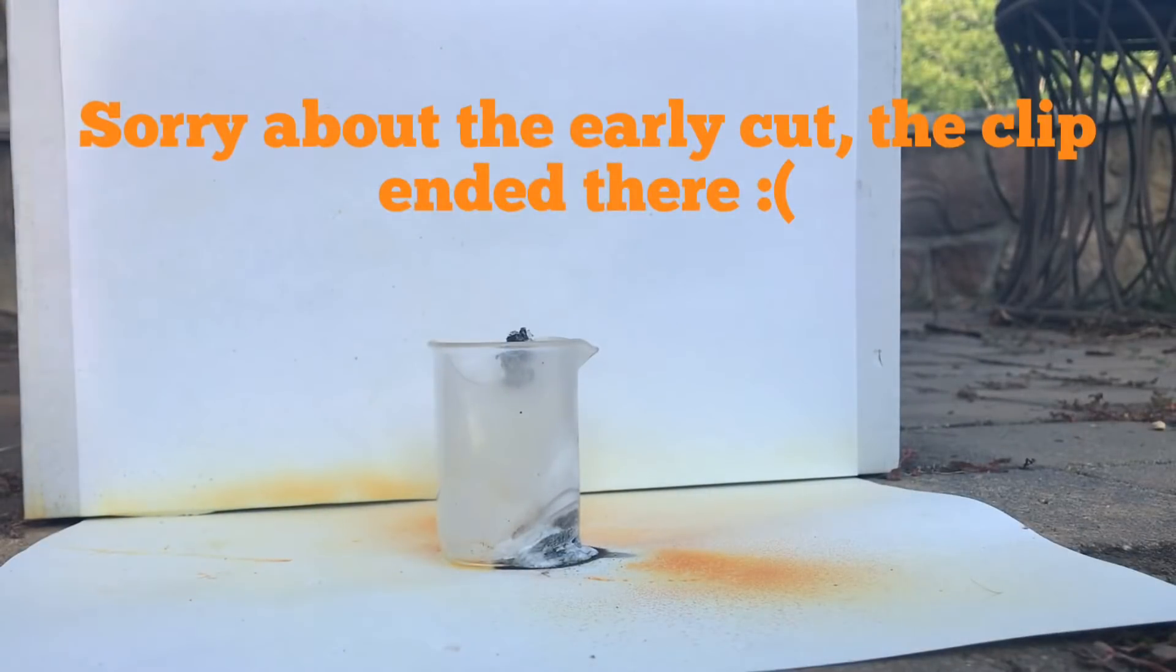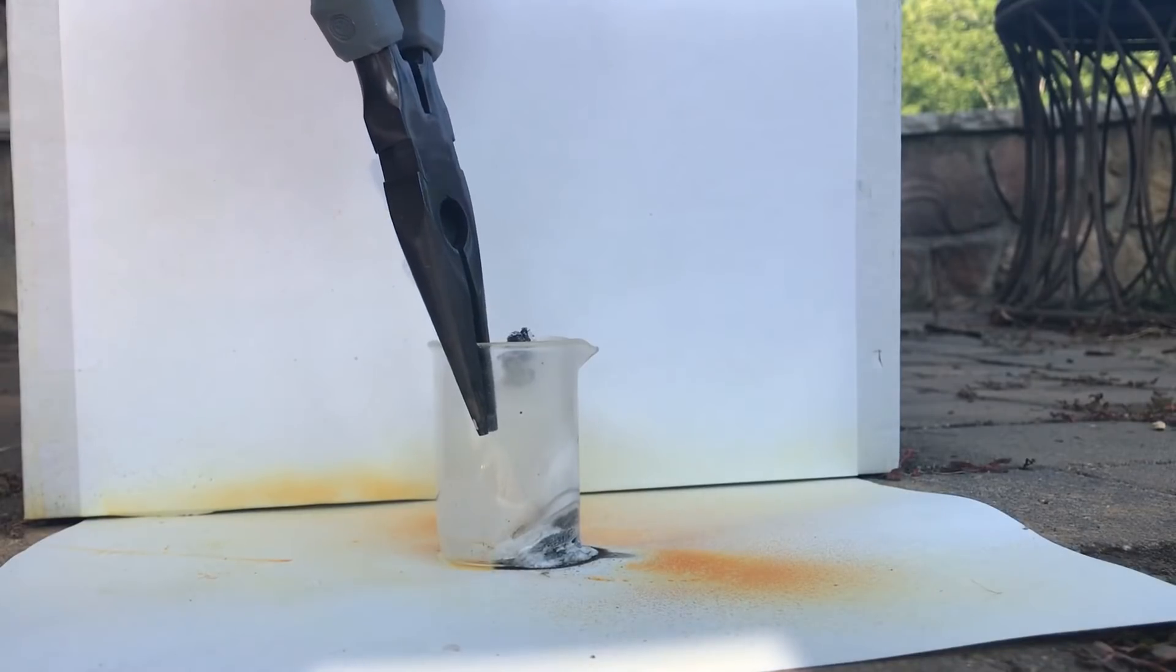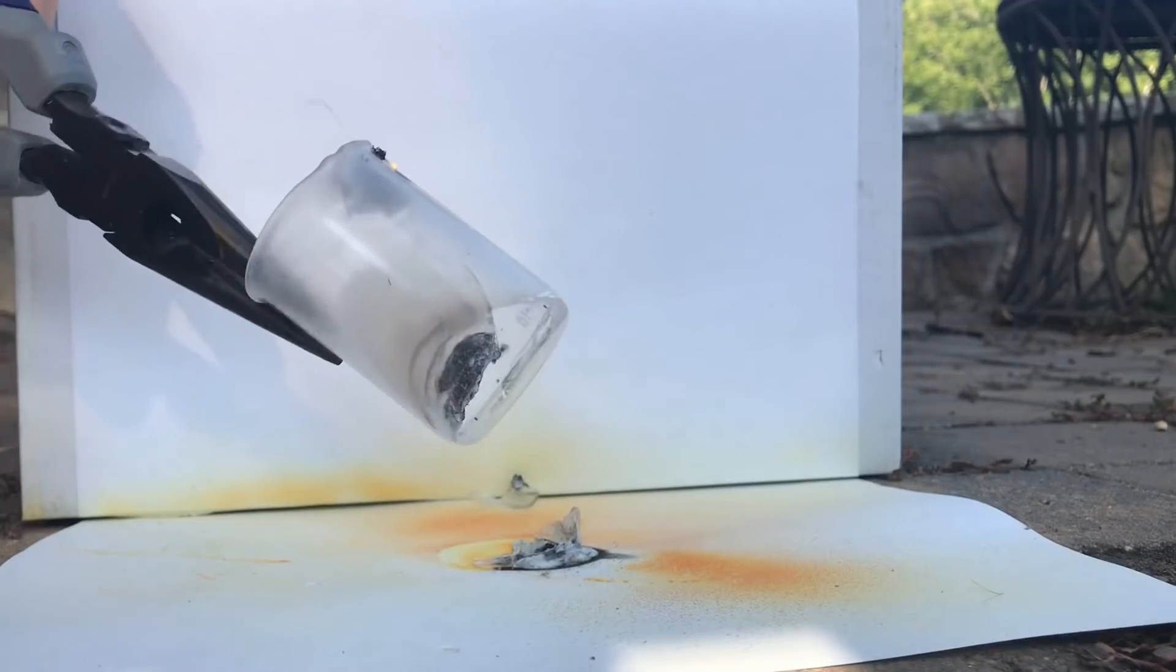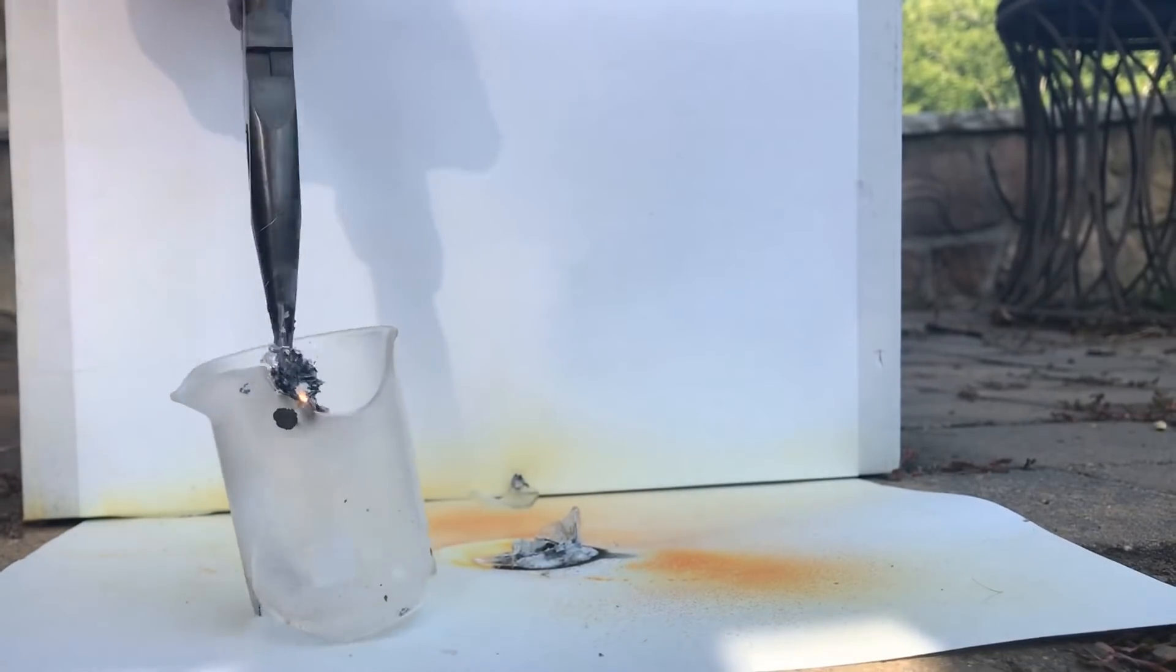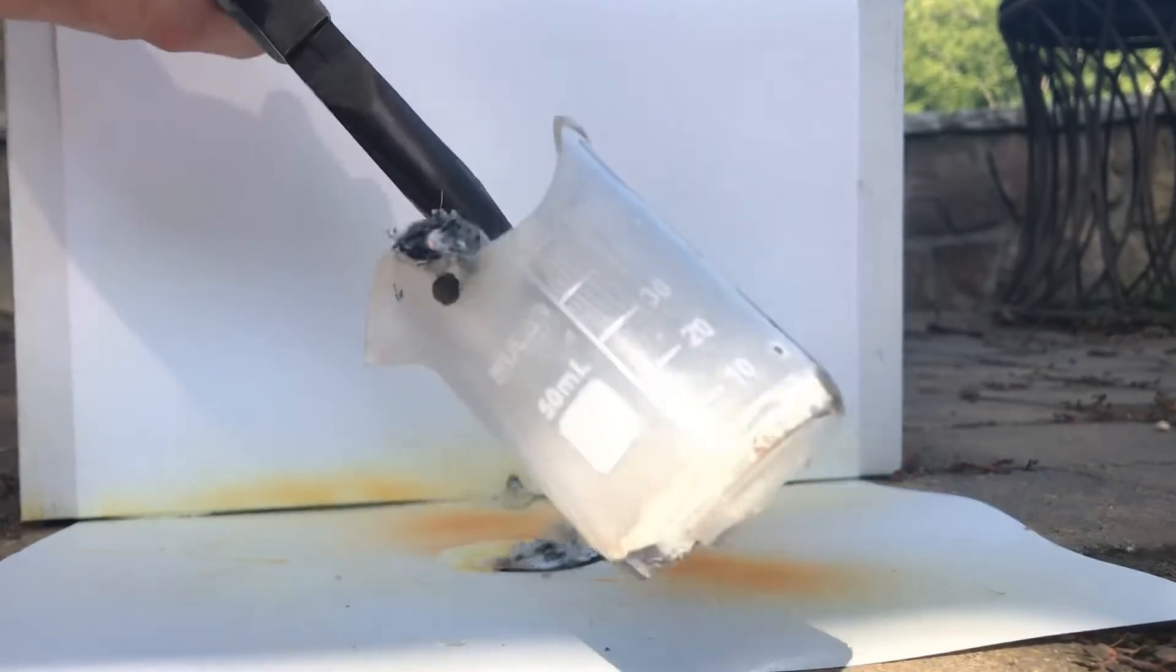So, as you see, yeah, lithium, oh my god, it's stuck to the ground. Oh! Wow, it's still burning. Well, I'd say, yeah, well, fun. Look at that.